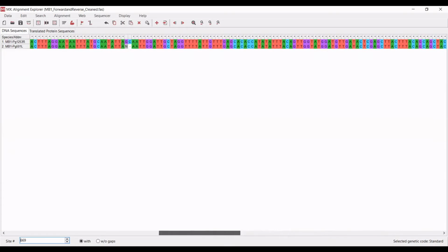We can find the unsure base call that we identified in the forward read. And if you recall, it was unclear whether the base was actually a G or a T. And so because we saw how clean the reverse sequence was, I feel confident in this base call here, also considering that it was between a G or a T for the forward read. And so I am going to retroactively remove that unsure sequence by replacing it with a G.